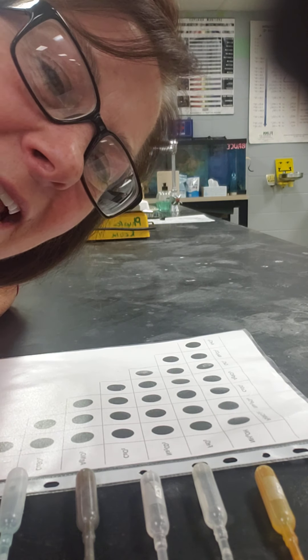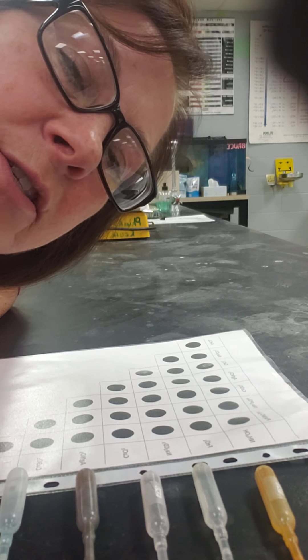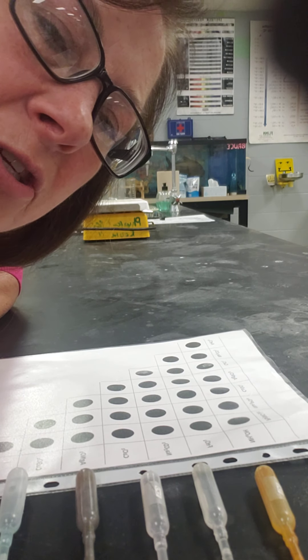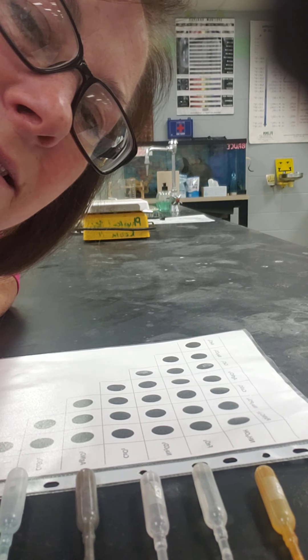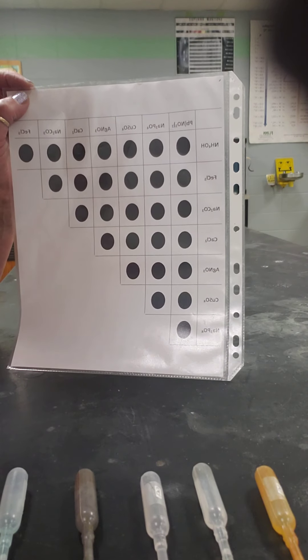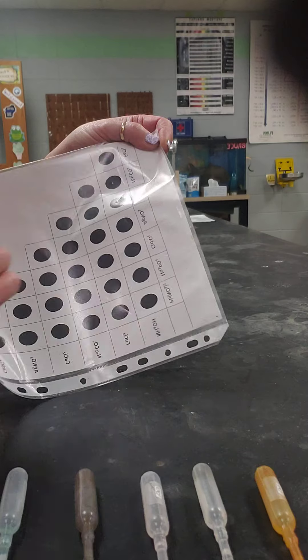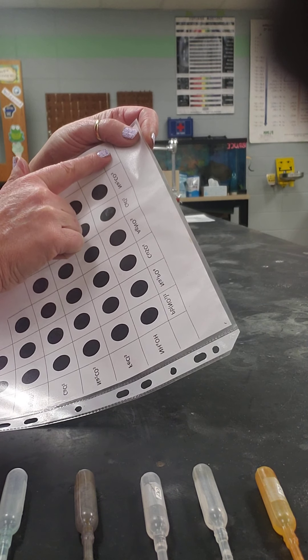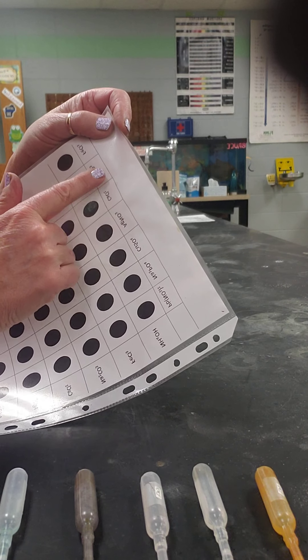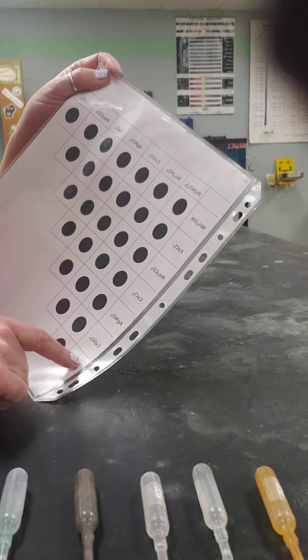Hi guys, we're going to do a lab today. We're going to do this lab in parts, so I'm going to do just one section of it right now, show you the process, and then show you the end result. On this acetate sheet I've got a grid of the compounds that I'm going to react with these compounds.